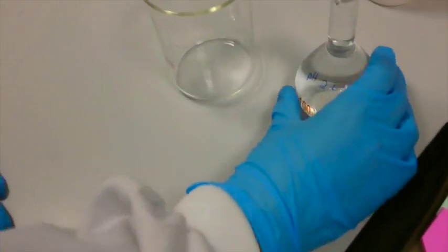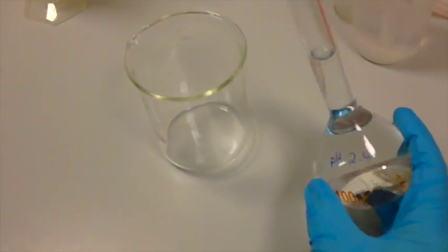The next step is to pour a small amount of this new solution into a beaker in order to check the pH.